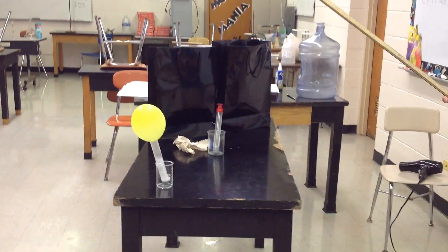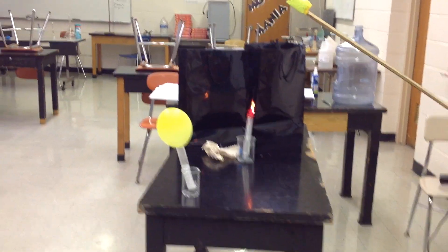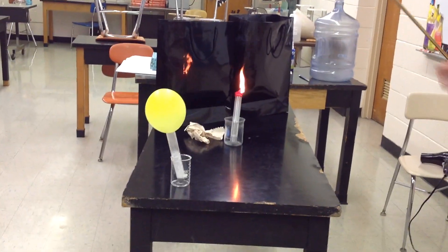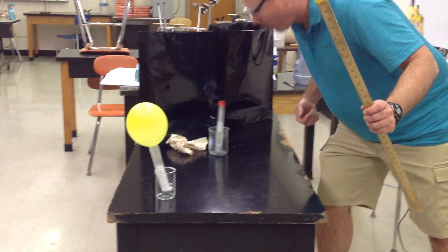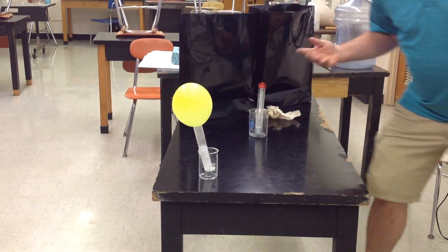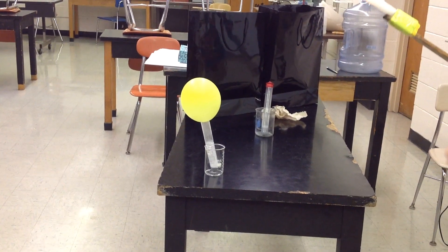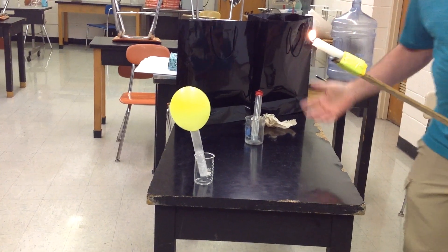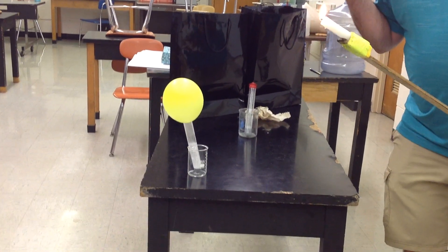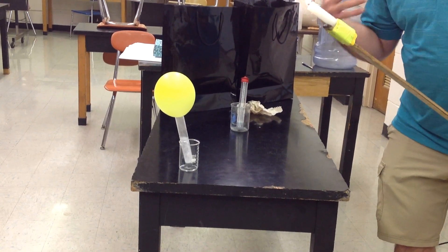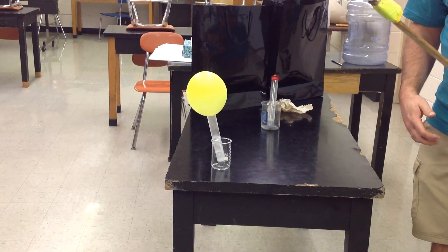Wow, that was great! That was so great. Let's do it again. So what kind of gas is that? Sometimes the balloons like to stay on fire. What kind of gas do you think that was? With the explosion, what kind of gas is explosive? Had to be hydrogen. I think hydrogen gas.